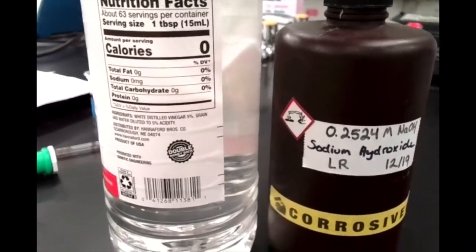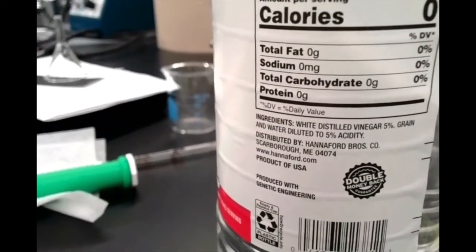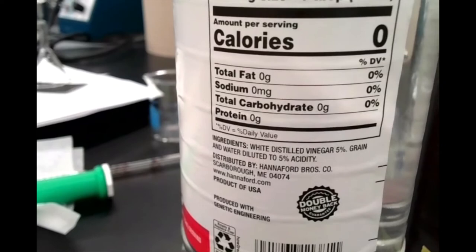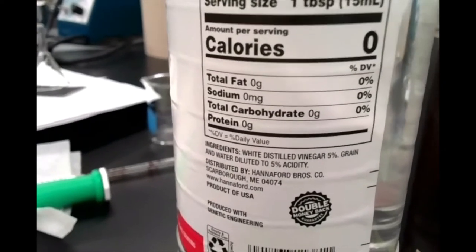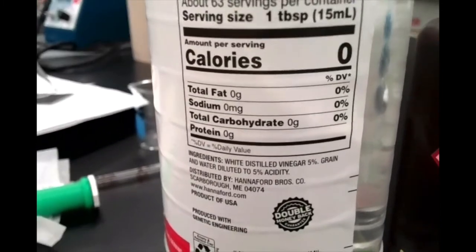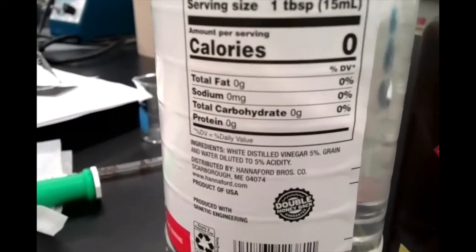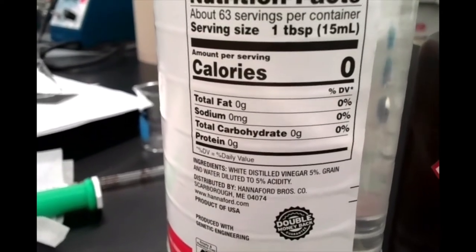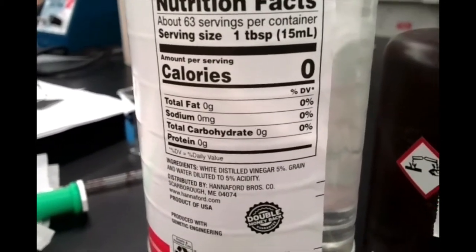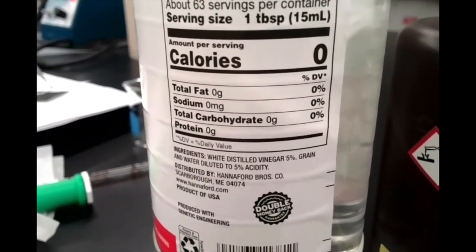A little spoiler — you can see that this is actually labeled on the bottle: 5% acetic acid in the vinegar. This is a great way to check your work at the end of the lab. When you're doing your calculations, hopefully you should wind up with your answer somewhere in that ballpark for percent m/v. Don't forget, we are doing two concentration calculations: both molarity and percent m/v.